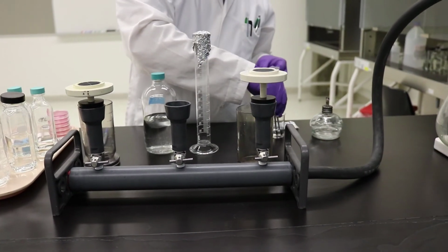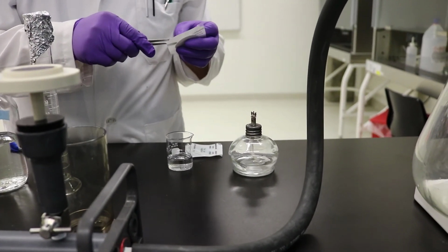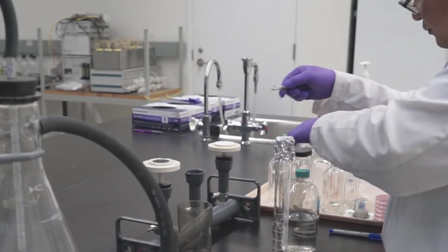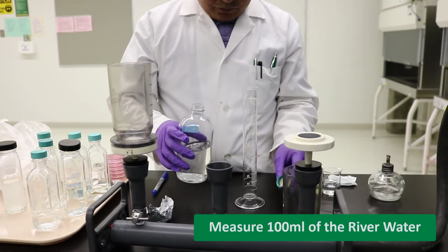For sample B, instead of performing serial dilution, simply measure 100 ml of the river water using the sterile graduated cylinder and repeat the filtration from the previous steps using another filter unit. Again, place the membrane in the agar plate.